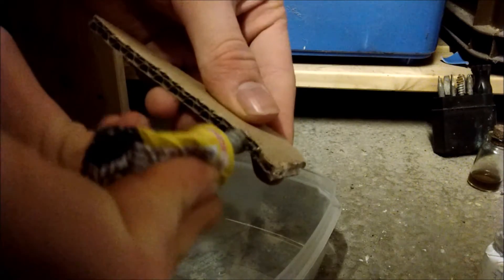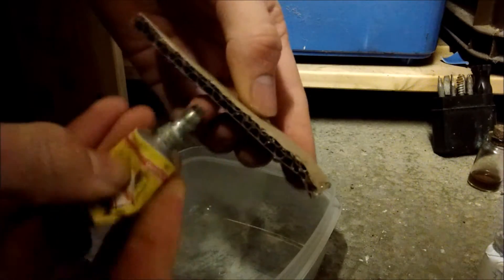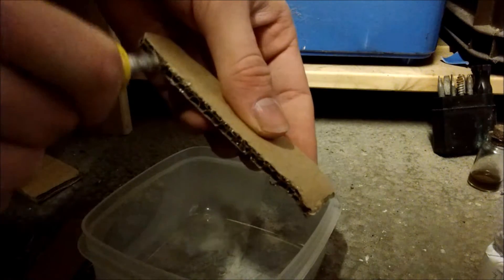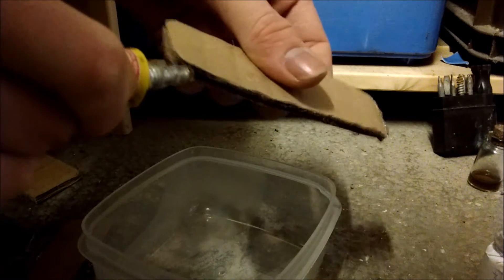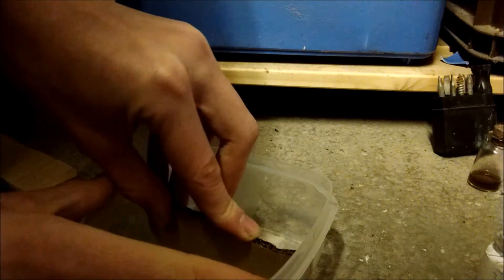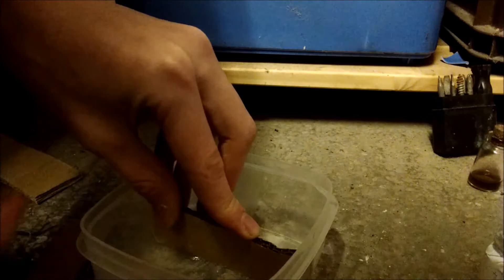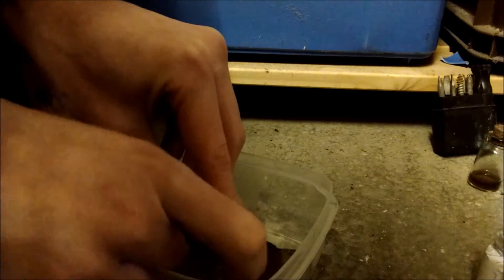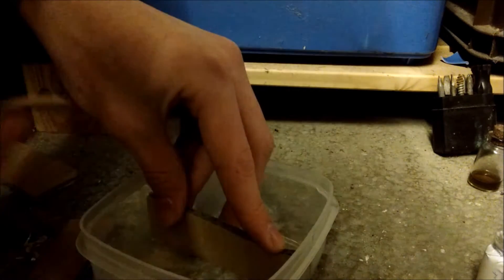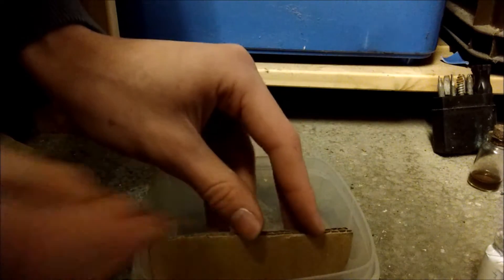Just on all the main surfaces, and just slide and press it down. Then get the stuff that's squeezed out the sides and just sort of run it along the edge to vaguely tidy everything up, make it fairly sealed, and do that on the other side.